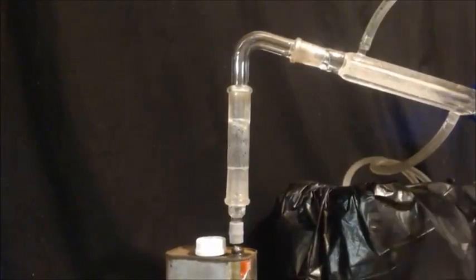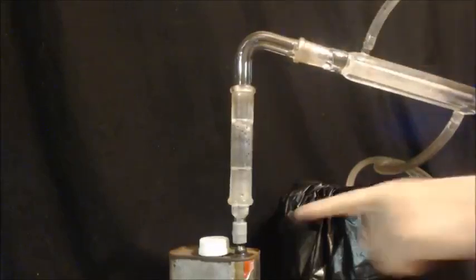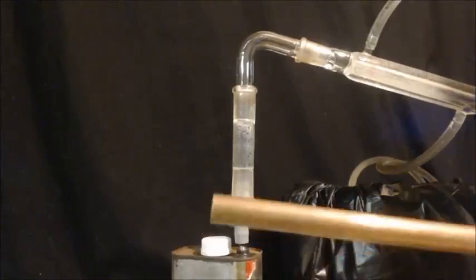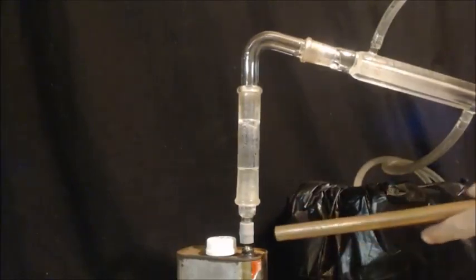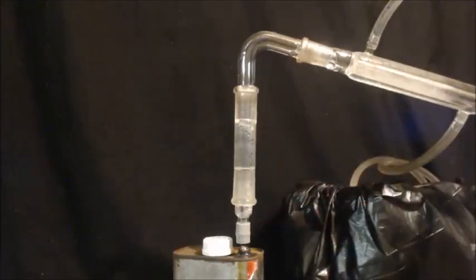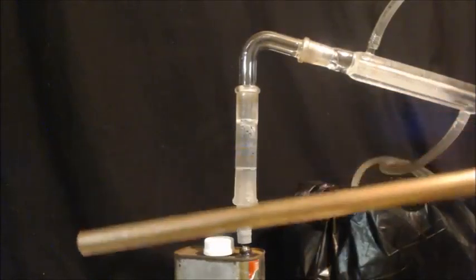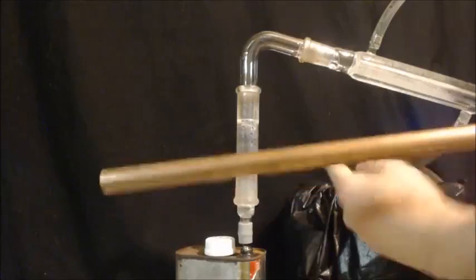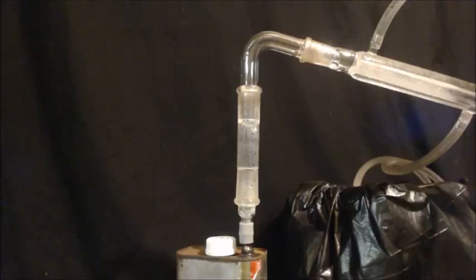Now, if I didn't have all this glass, I could take this copper pipe and bend it right here so it made this shape, and then put it in the hole there. Make the hole just slightly bigger than this pipe, so I have to almost smash it in there so it's nice and snug. And then I'd epoxy the copper pipe to this instead of that attachment. And then I would wrap plastic tubing all the way around this, with an end sticking out on each side, and I can connect that to my water pump. And so it'd be a water-cooled condenser.